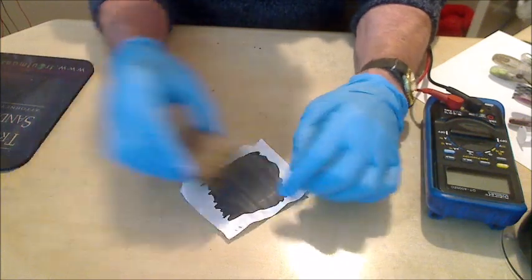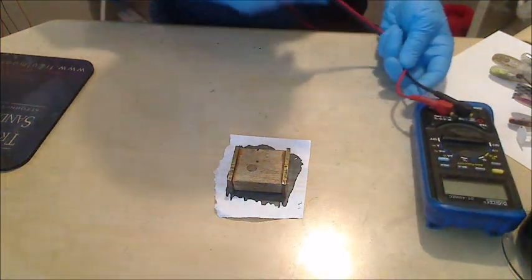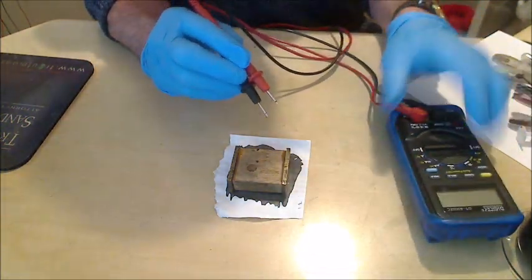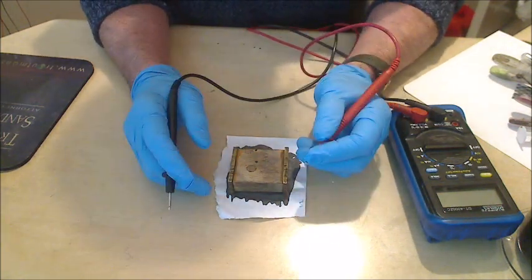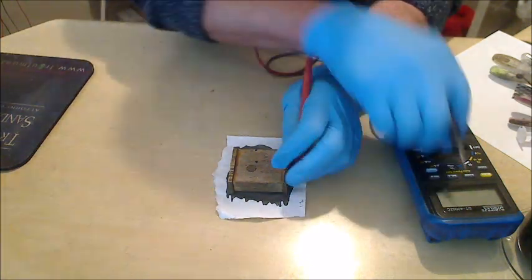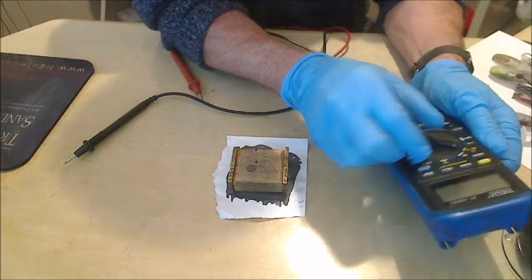But generally speaking, I'm getting pretty good conductivity, and I don't need to burnish it at all, which tells me that the layers of the graphene platelets are laying flat rather than lumps of graphite, which when you burnish them, you obviously compress them into a layer. This is my belief, I could be wrong. Anyway, I'll show you the results I get here.